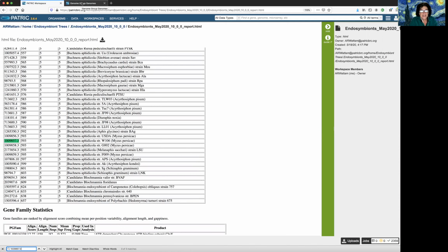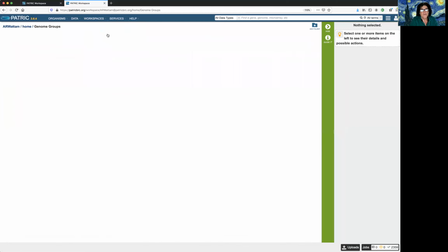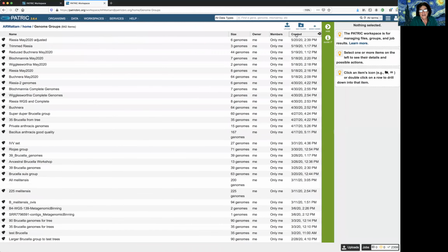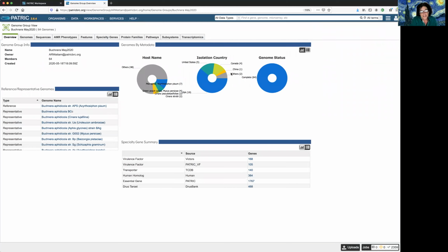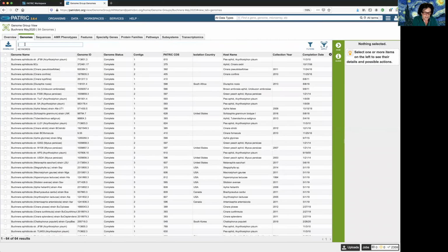So I'm going to go back to this other tab. I'm going to go into my workspaces, click on genome groups. I want to see my most recently created ones. And let's see, Buchnera, here it is. So I click on that, and I want to go to the genome group view. So once again, this is showing me all the metadata and stuff that are interesting for this entire group that can include 64 genomes.